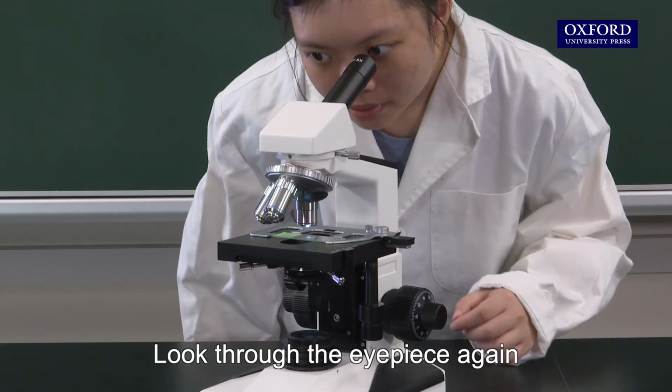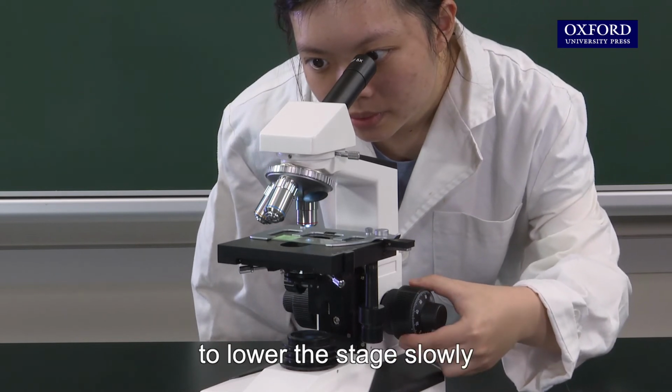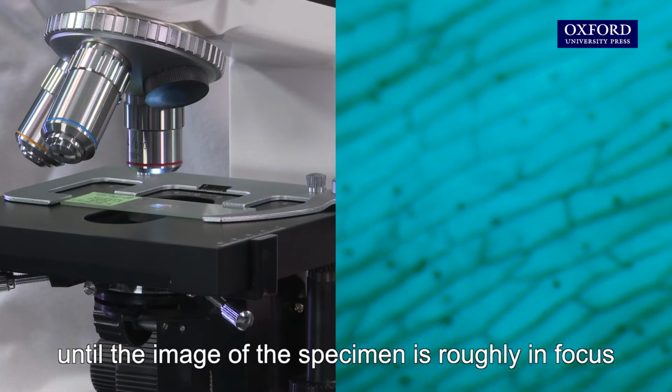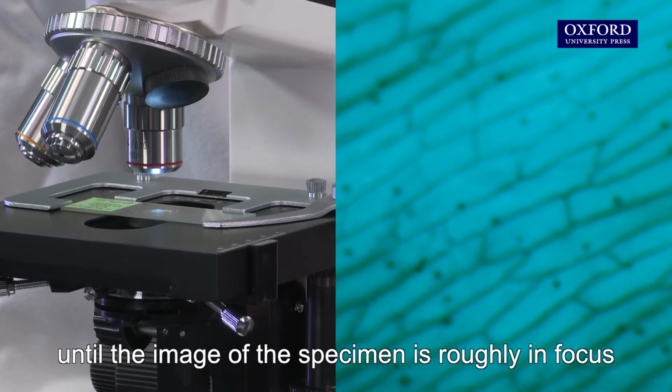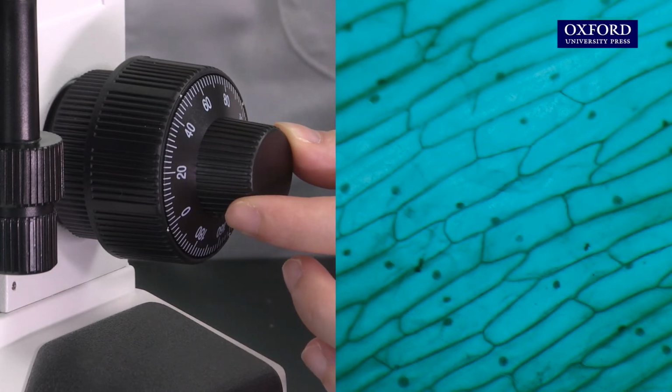Look through the eyepiece again. Turn the coarse adjustment knob to lower the stage slowly until the image of the specimen is roughly in focus. Turn the fine adjustment knob to get a sharp focus.